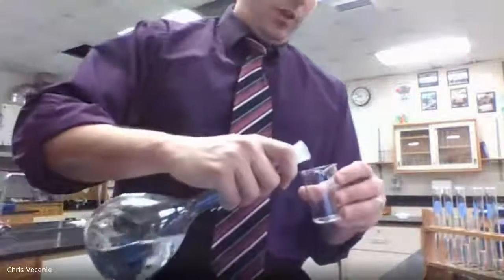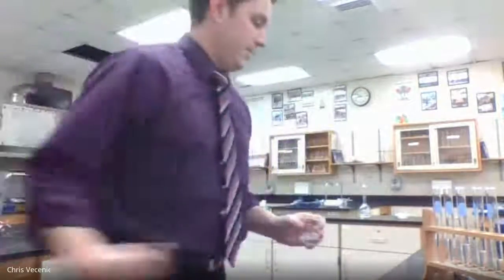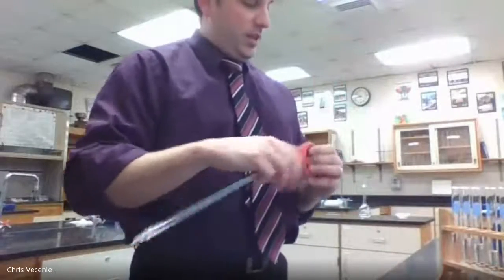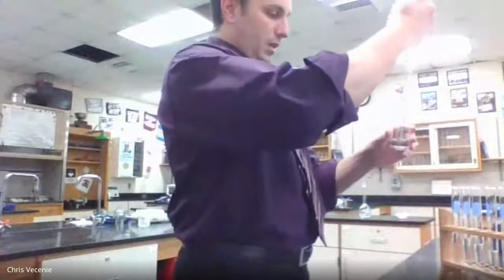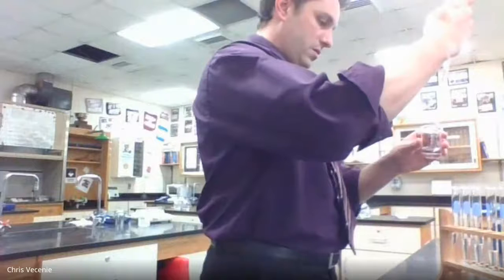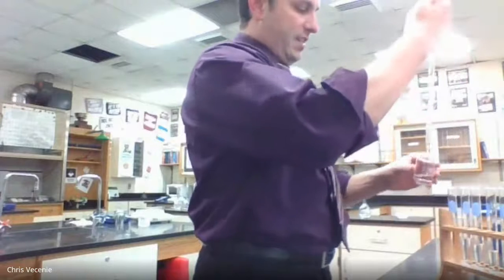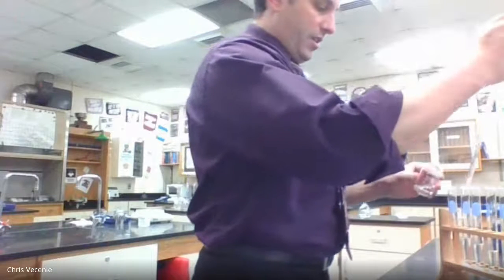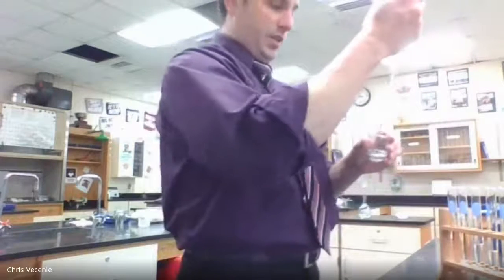Then the same drill, but we use 2, 3, 4, 5, and 6 milliliters for this one. The 2 is going to go in with the 8 that we did in the first one, and then the 3 in with the 7. So notice we have a constant 10 milliliters for all of the containers. So 2 in this first one. And notice what we're doing here is initiating that reaction we talked about in the pre-lab. We're creating that iron thiocyanate ion, which is supposed to have that quote unquote blood red color to it.